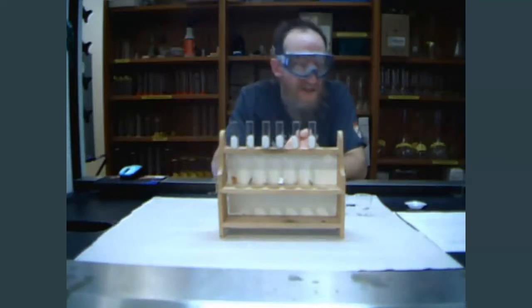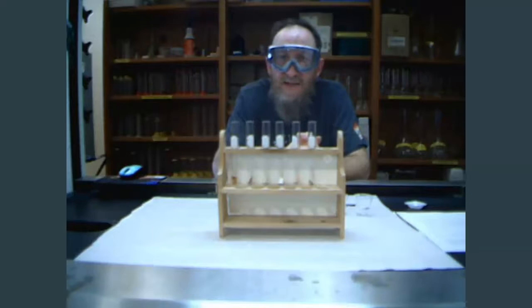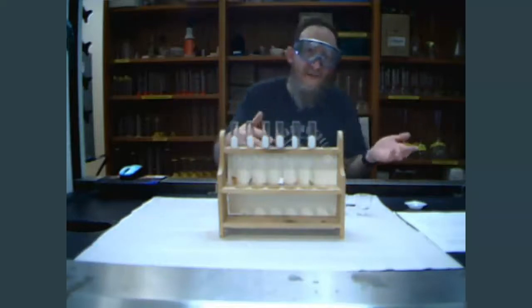So I have three pieces of zinc, two pieces of copper, one piece of lead in each of the test tubes, and then I'm going to add these solutions to them. Now, a lot of times with these reactions, they're not instantaneous. Sometimes they are, sometimes they're not.